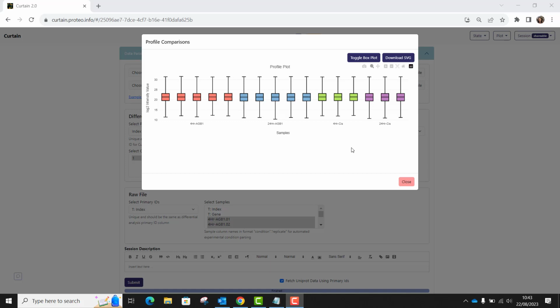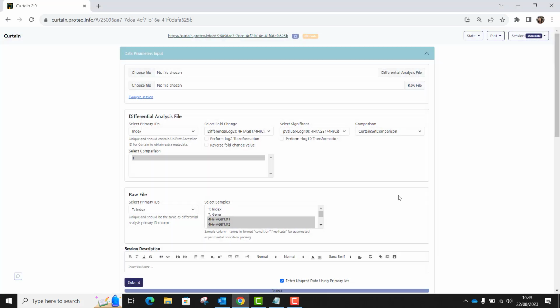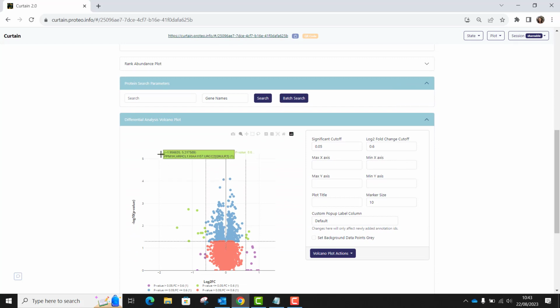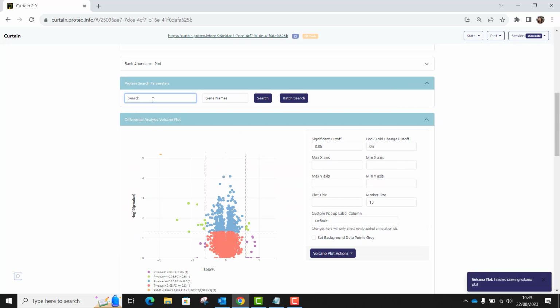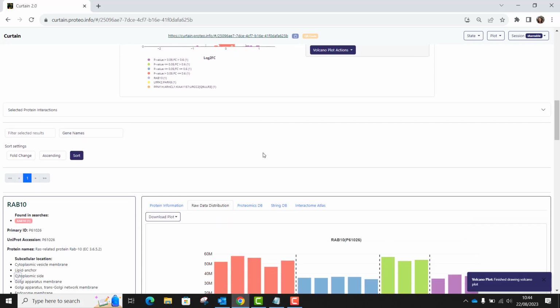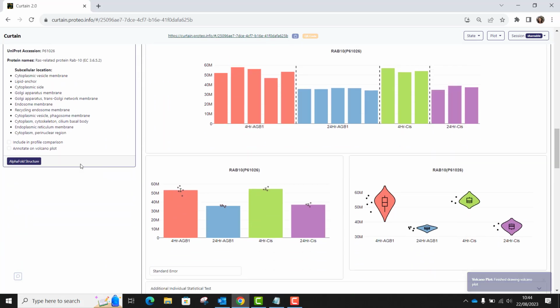You are also able to view the log2 intensity for individual proteins on the profile plot. So, for example, I'd like to look at the intensity of 3 proteins. One is ppm1H here, the other is LRRK2, which I'll just search for. And the last is RAB10, which I'll also search for. Now that all of these are selected, I'll scroll down and check this box here, include in profile comparison.